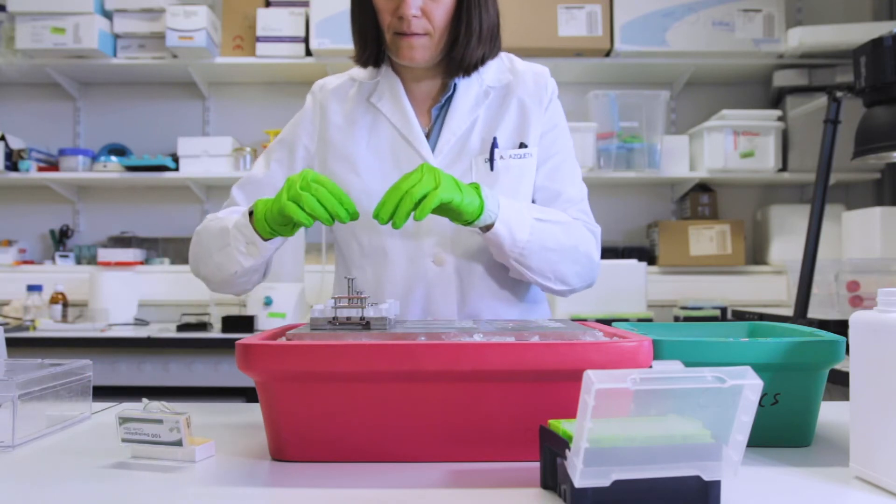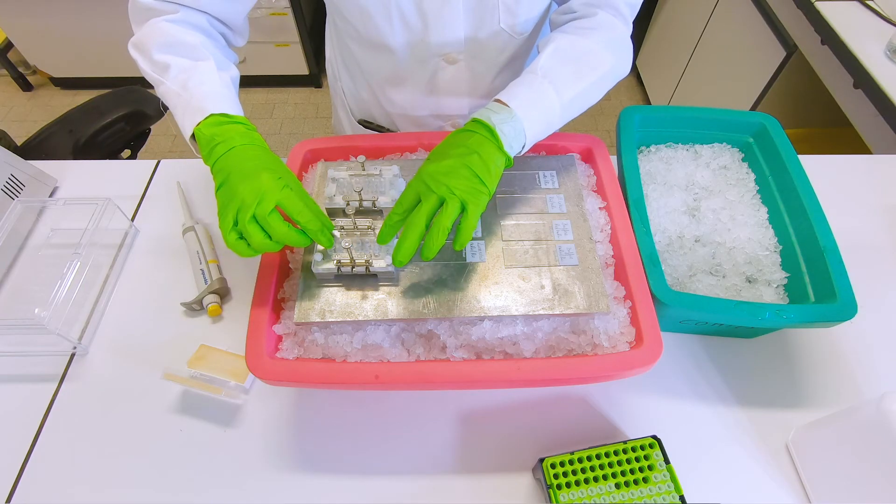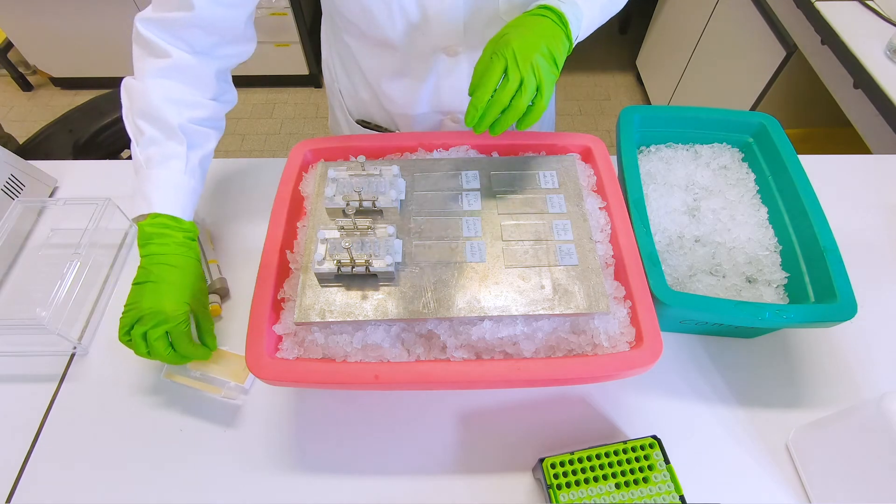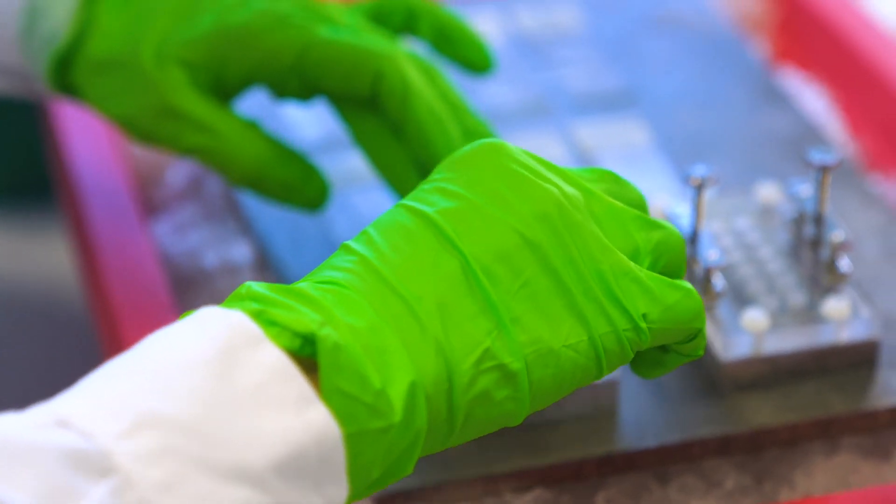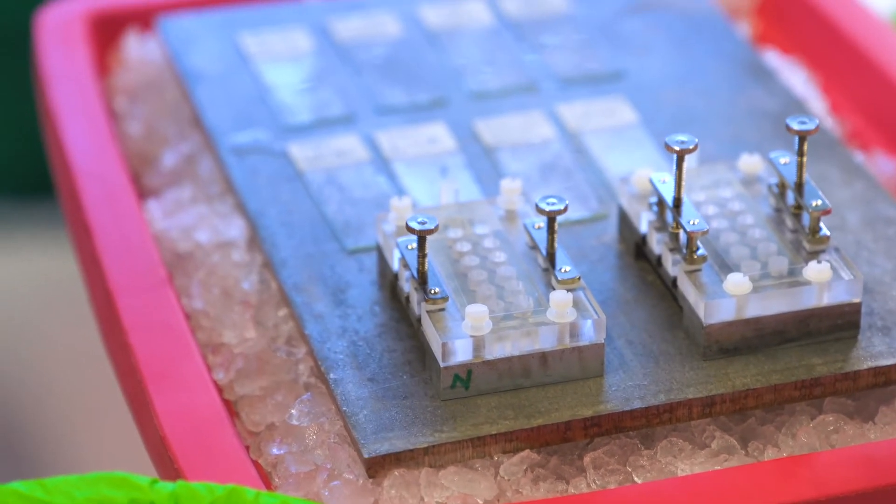With the 12 gel systems it's important that you also cover the wells. We usually do this with a cover slip or a slide. And then all of this can go to the incubator.